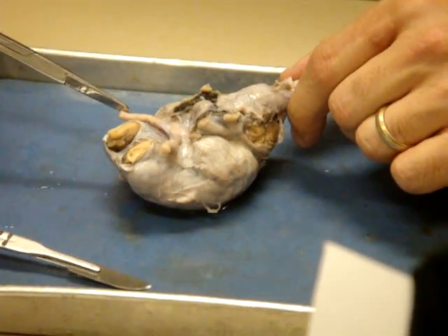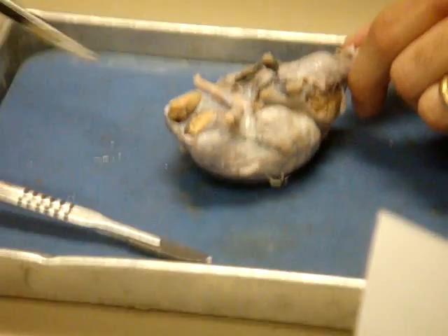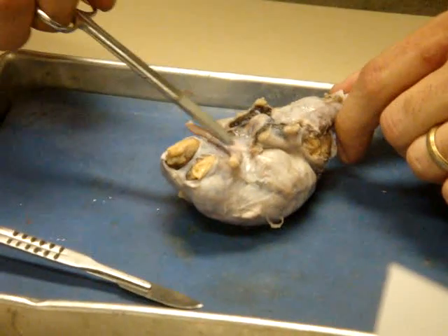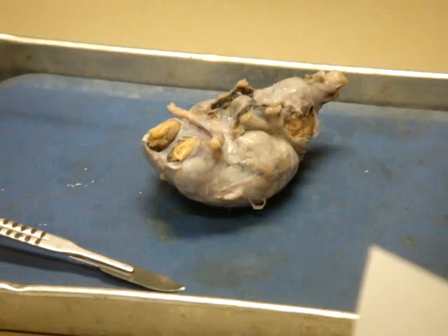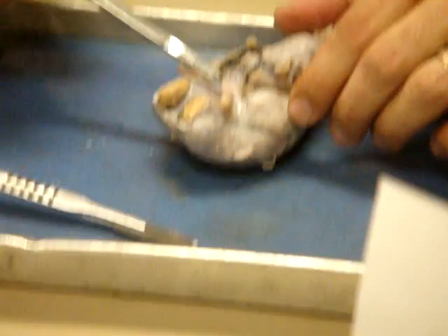Then we see these. What cranial nerve do you think those are? Optic. Good. Those are optic. Those are going to continue to the eyes. And we'll see they're going to come back and they're actually going to cross right here. When I remove that dura, you'll see the cross a little better. And we want to be careful. We don't just want to rip off the dura mater because it'll rip those right off. We'll try to preserve those. We call that the optic chiasm.